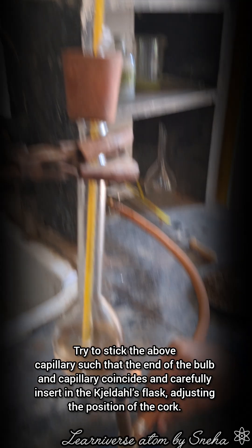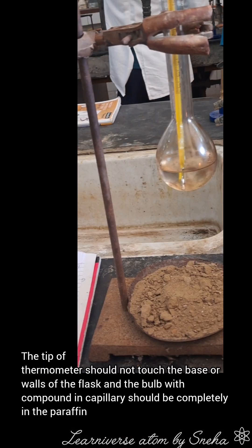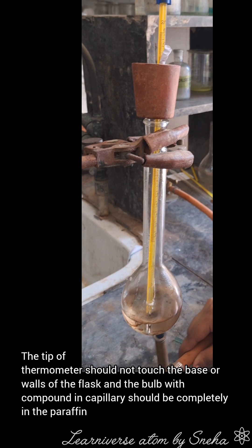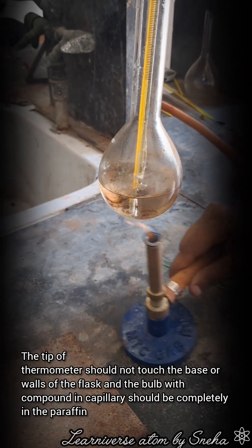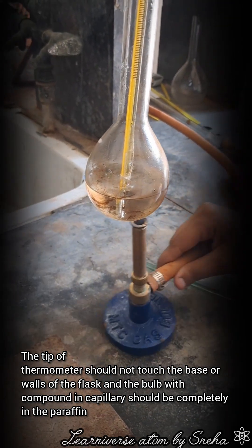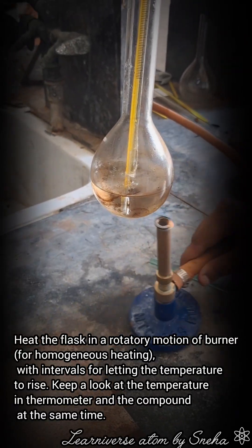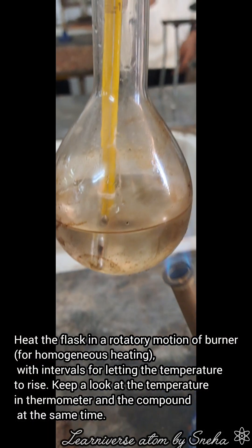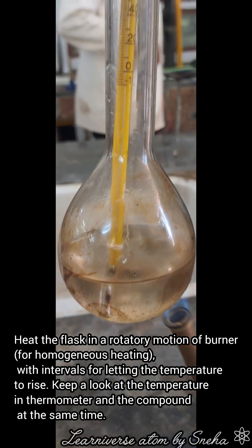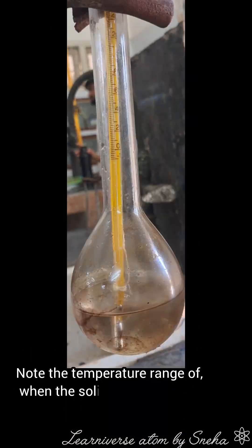Carefully insert in the Kjeldahl's flask, adjusting the position of the cork. The tip of the thermometer should not touch the base or walls of the flask, and the bulb with compound in capillary should be completely in the paraffin. Heat the flask in a rotatory motion of burner for homogeneous heating, with intervals for letting the temperature rise. Keep a look at the temperature on the thermometer and the compound at the same time.